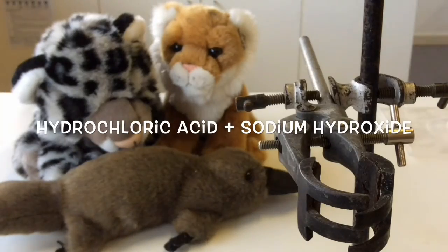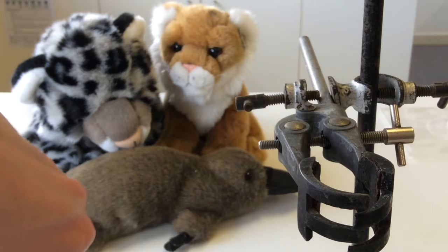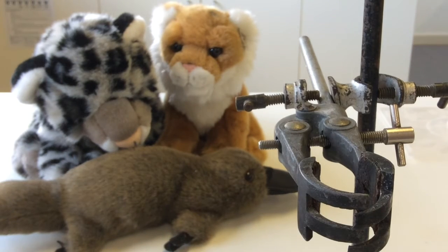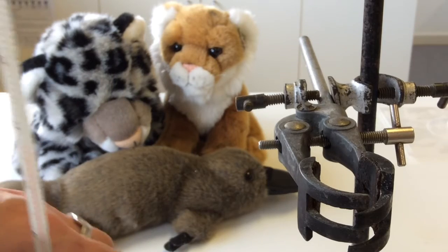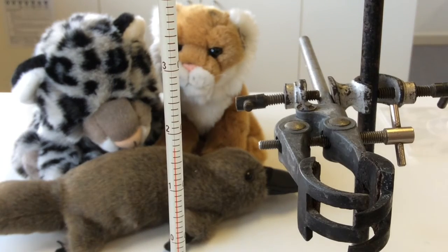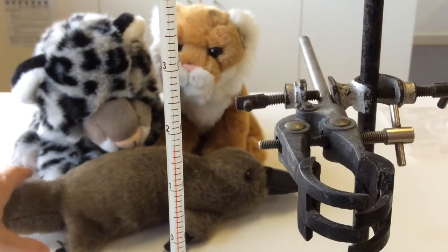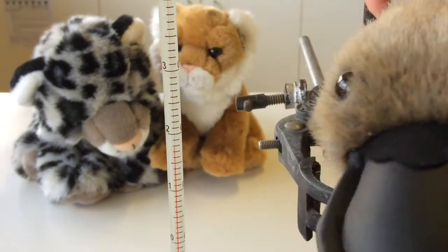Okay, so 50 mils of the hydrochloric acid is going into the calorimeter, and then we need the temperature to settle. Now all these chemicals have been sitting out in the science room, so they're not going to take long to reach a constant temp. Well, actually, they're probably not going to change at all. At the moment I've only got the 50 mils of hydrochloric acid. Alright, so this is the acid and the base one.